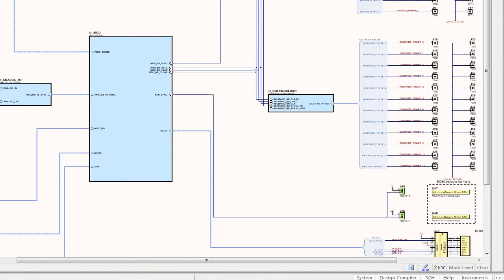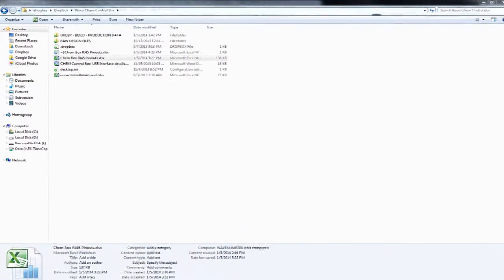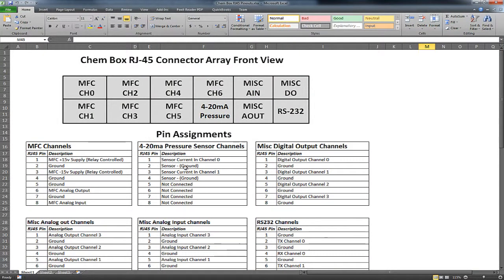One thing I did want to point out is in the root directory, where all the files are, there is a file called Chembox RJ45 pinouts, and it's just a nice Excel sheet that gives a quick cheat sheet of all the pinouts if you don't want to go to the schematic. So what these boxes up here show is, if you're looking at the RJ45s from the front of the box, what each of the jacks are for, for example, mass flow controller channel 0, and I show the pinout.